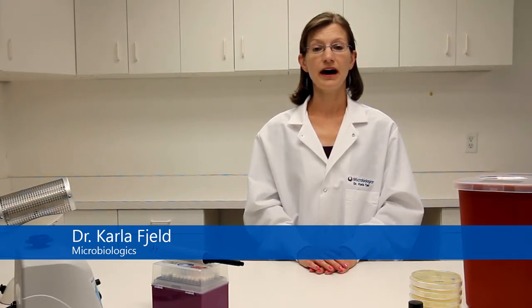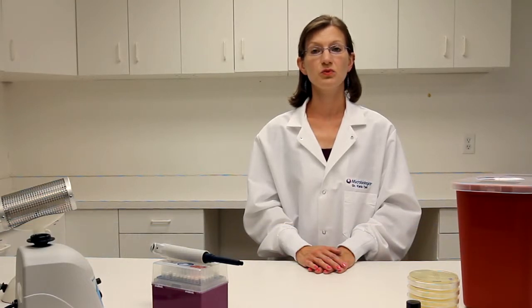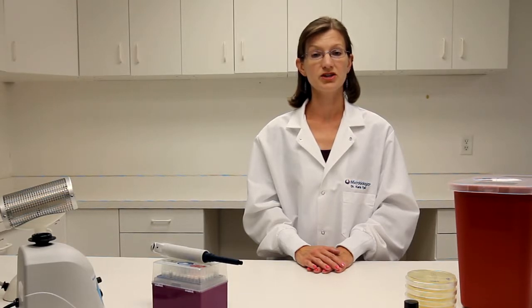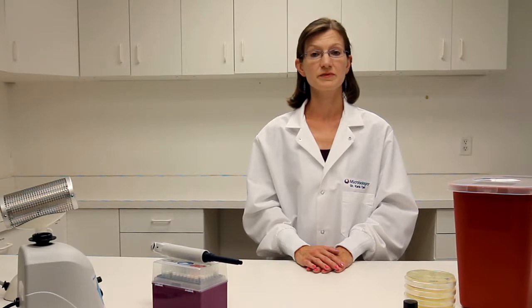In this video, I will explain the serial dilution process and demonstrate how to perform dilutions when using the Microbiologics ePower product. Dilution is the process of making a solution weaker or less concentrated. In microbiology, serial dilutions or log dilutions are used to decrease a bacterial population to a required concentration. The purpose is to achieve an appropriate concentration for a specific test method or to achieve a countable agar plate.